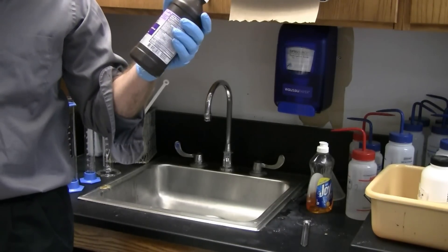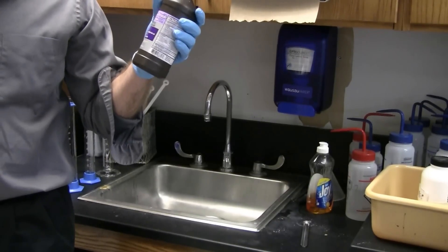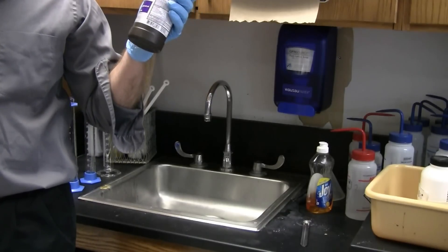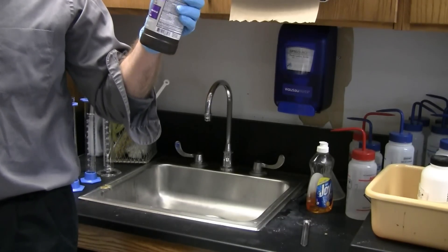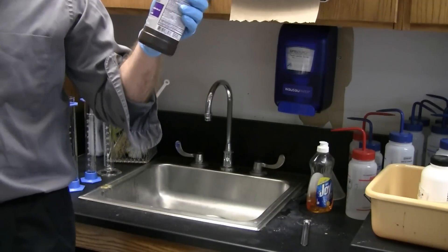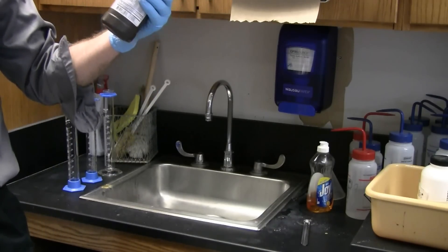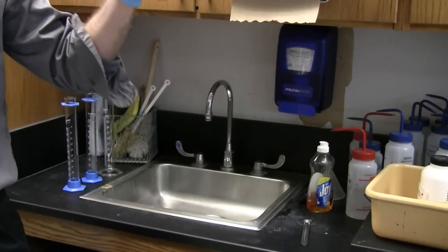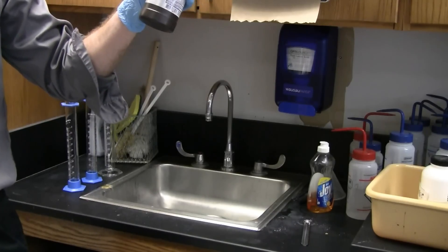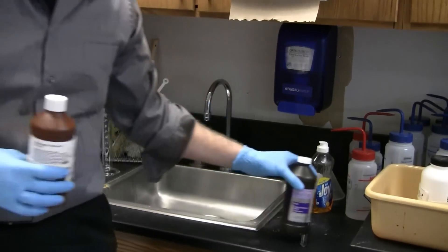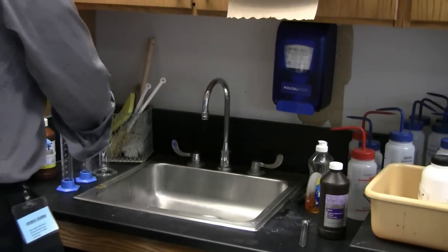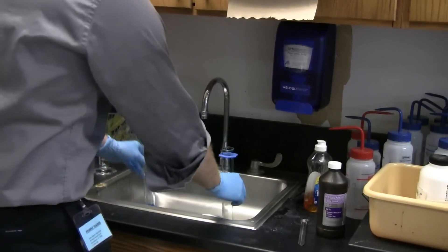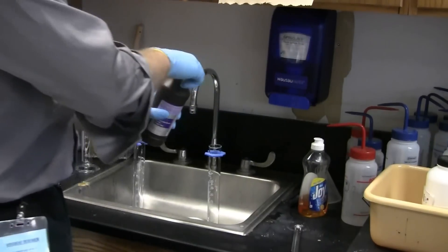So we're going to do a little demo here that shows decomposition and introduces something else. We're going to learn about reaction rates. So which one do you think will react faster, the 3% or the 30%? 30%. So what we're going to do is dump 20 milliliters in each of these cylinders.